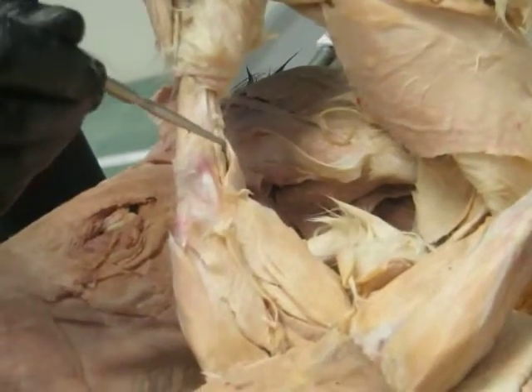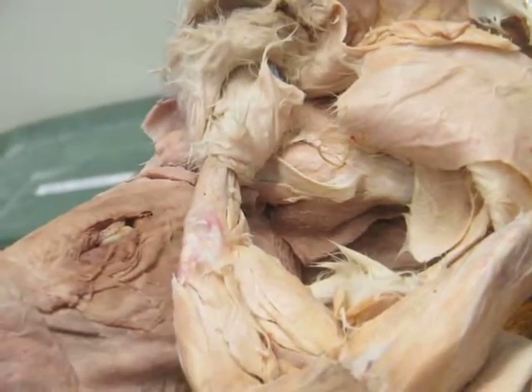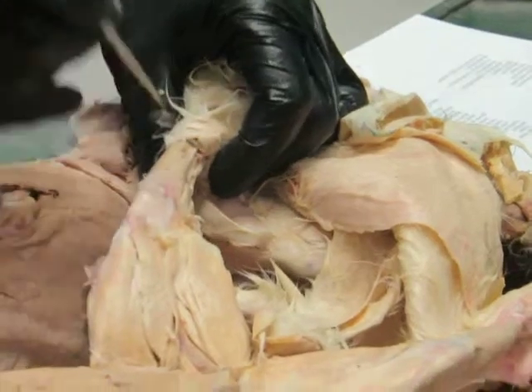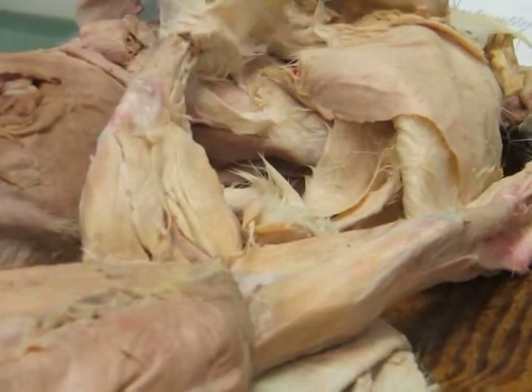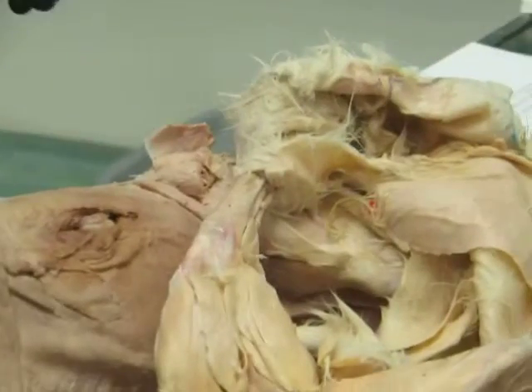It's a little flat muscle. And those three muscles join together, the two heads of the gastrocnemius and the soleus, to come into the Achilles tendon here that then inserts into the calcaneus. And that's the main flexor of the ankle joint, okay, which is the main muscle involved in propulsive stroke. Generally pretty well-developed muscle there on the backside.